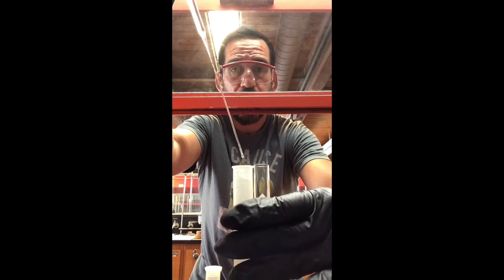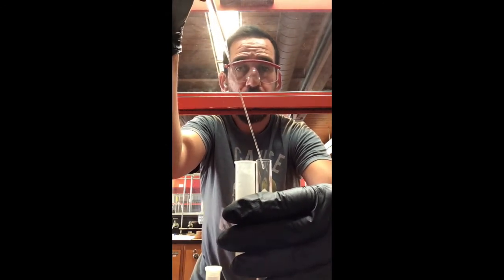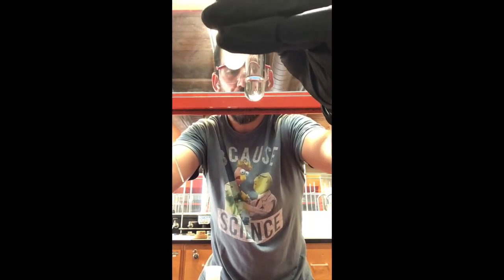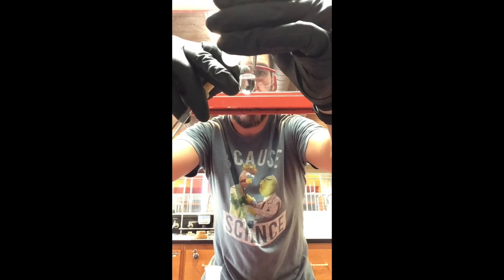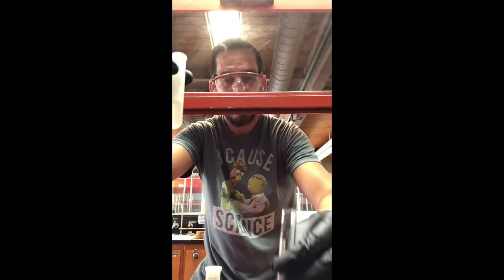What I can do also is just add a couple drops back to the centrifuge tube, and then you see it dripping, drop. Now I move over, and I didn't spill any, so now I can squeeze that into the glass test tube, and it looks nice and clear, right? There's no two layers there. This is just kind of the way the glass looked. Oh, right there, it kind of looks like there might be two layers, but that's just a reflection. So there you go. That's how you would transfer the methylene chloride layer into a clean test tube.